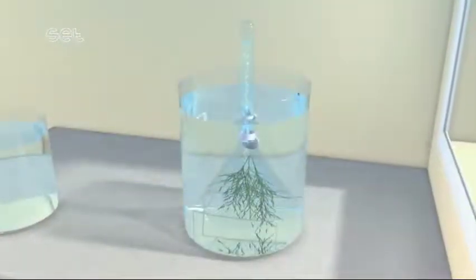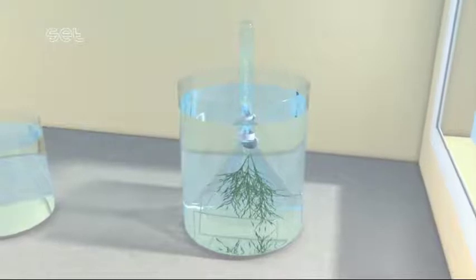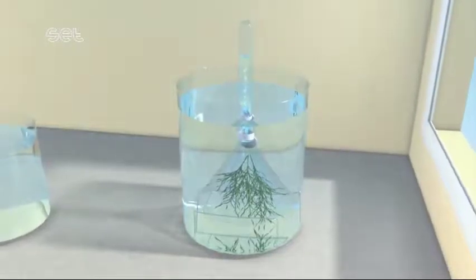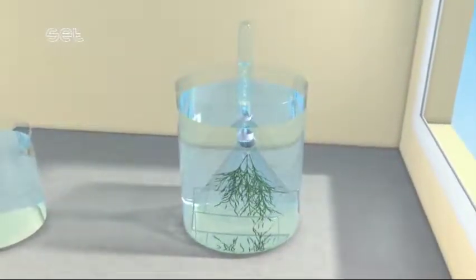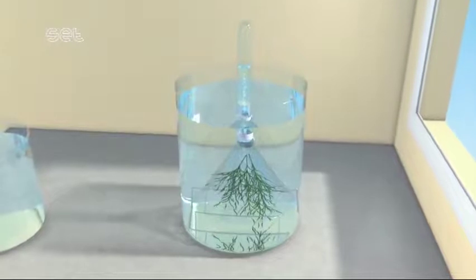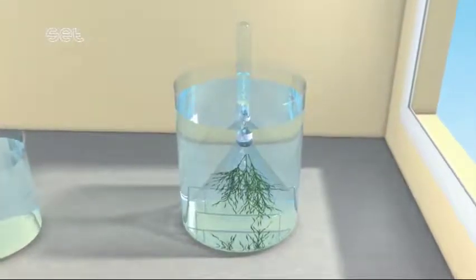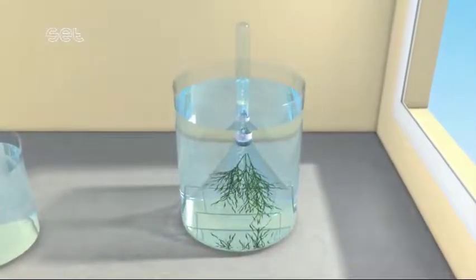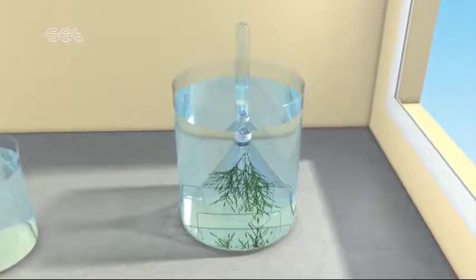With the influence of light, the Elodea plant photosynthesize and produce oxygen bubbles. The oxygen bubbles move from the funnel into the test tube and collect there.